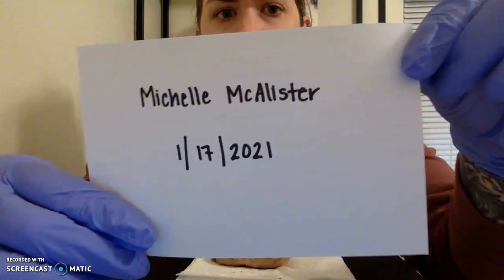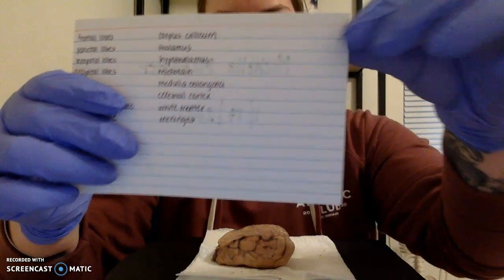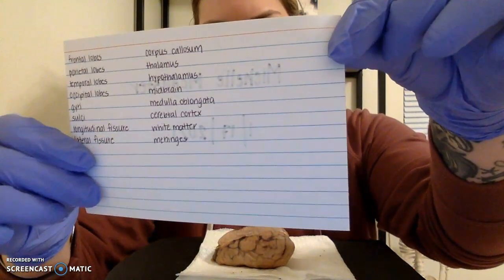Good afternoon, my name is Michelle McAllister, and today we are going to look at a dissection of a sheep's brain. This is my name here, and this is the list of structures that we are going to look for today. So let's set that right here.